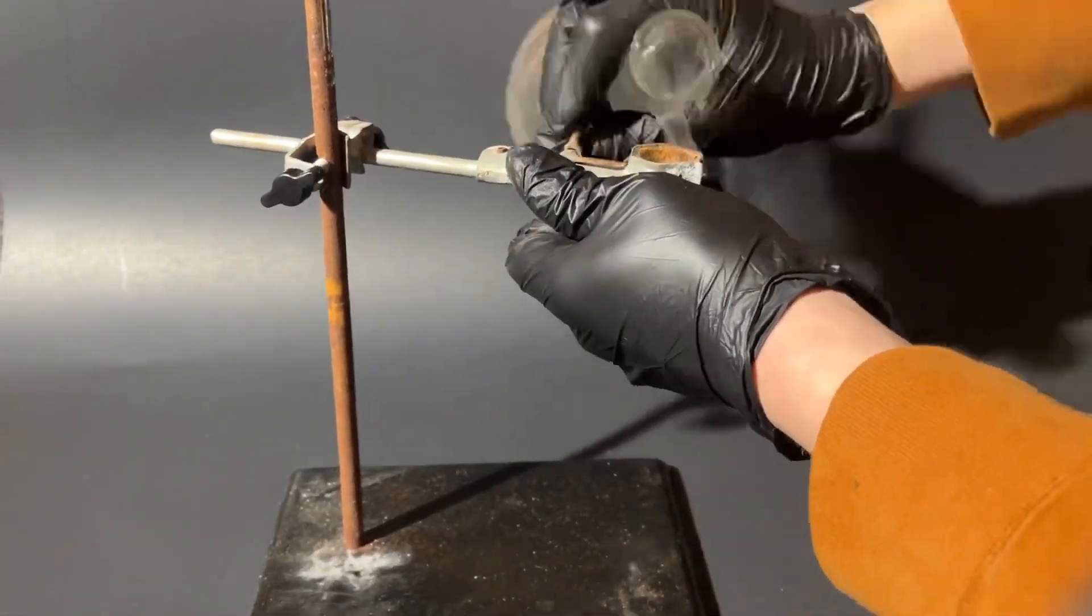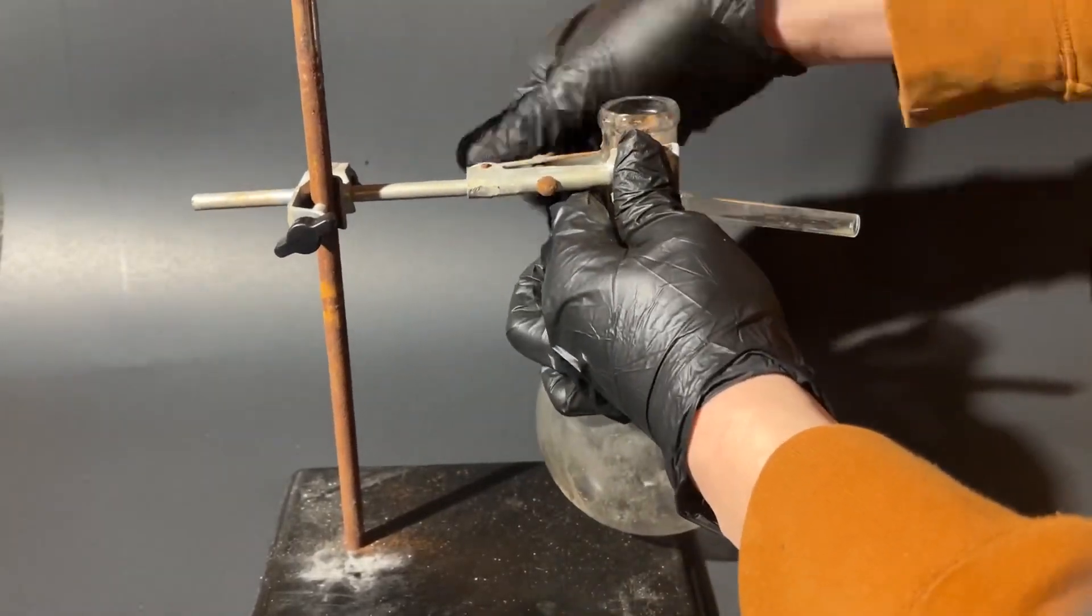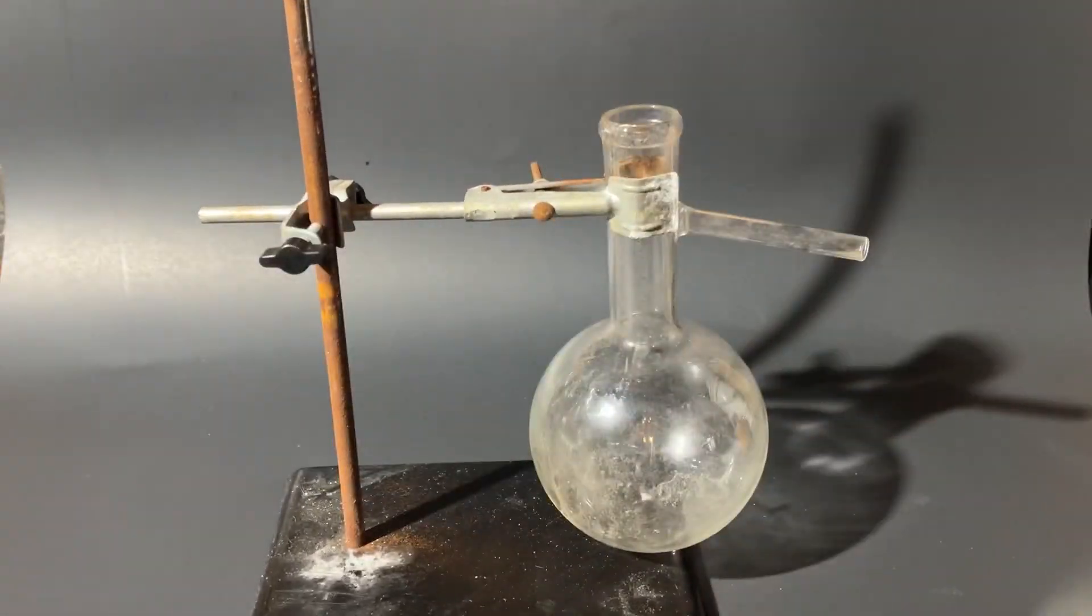So in this video, I'm going to be using my knowledge in chemistry to make them here in my garage, and hopefully I'll have a good reaction to them.